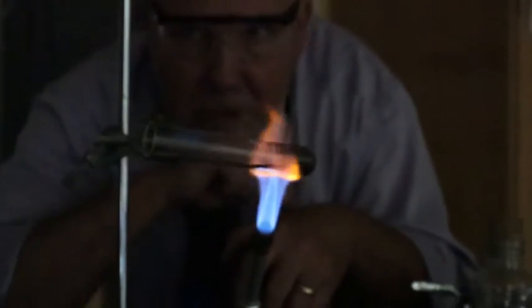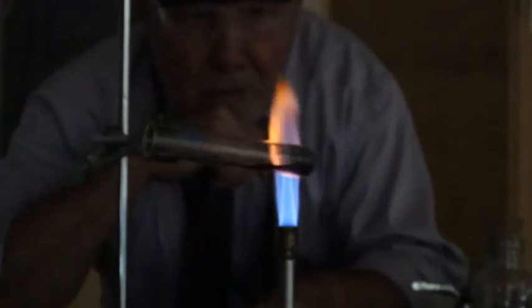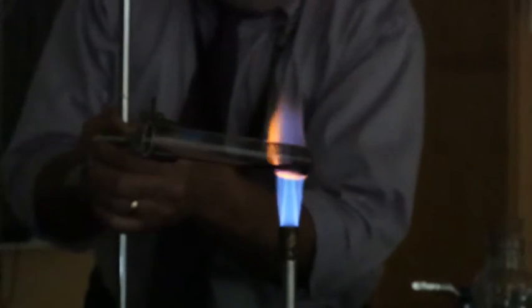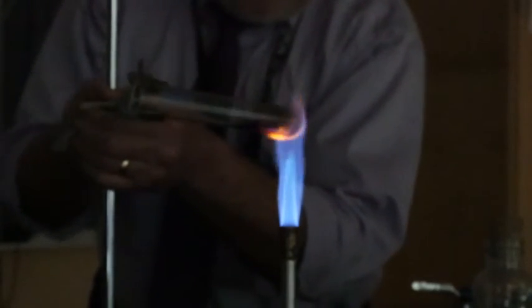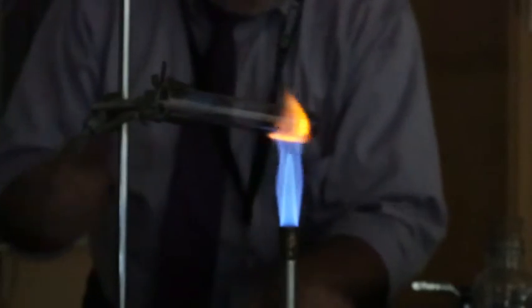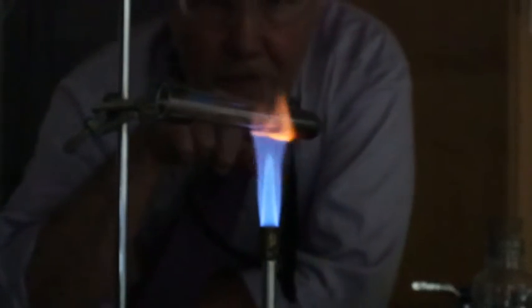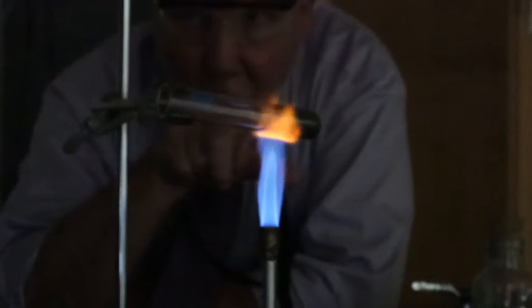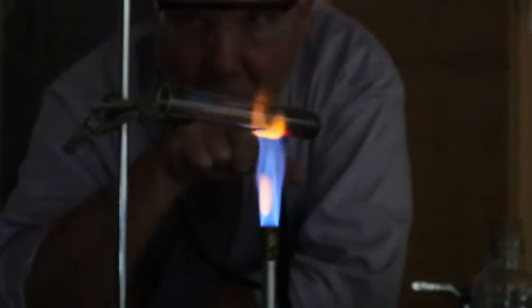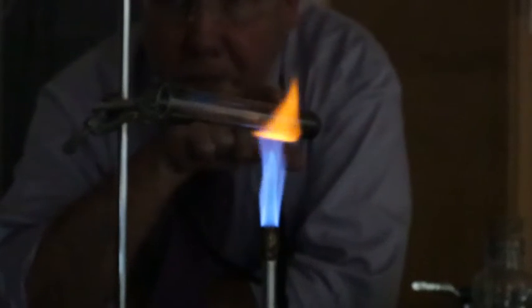See, what's going to happen here is, and it looks like maybe I need to turn on my lights a little bit. It looks like the liquid moisture there, I've got to heat that up. So what I'm going to do here is I'm going to eventually evaporate off that liquid, because I don't want that. I'm interested in the product here, the copper oxide that I'm making. And once this cools, then we'll get the mass of it.